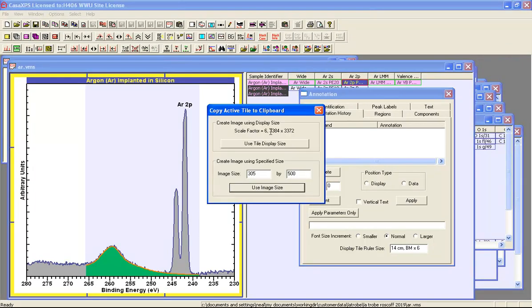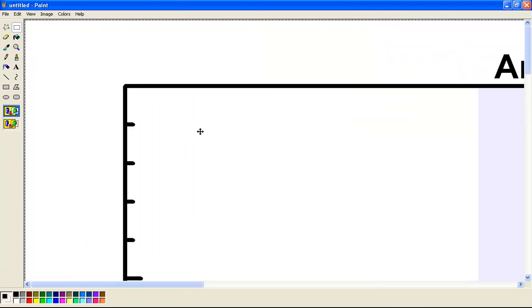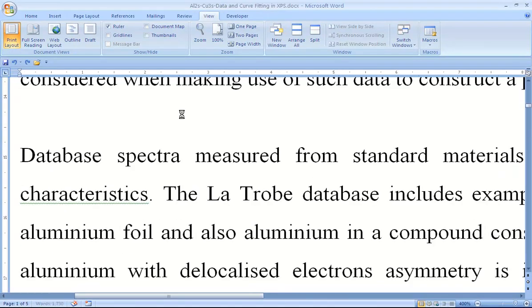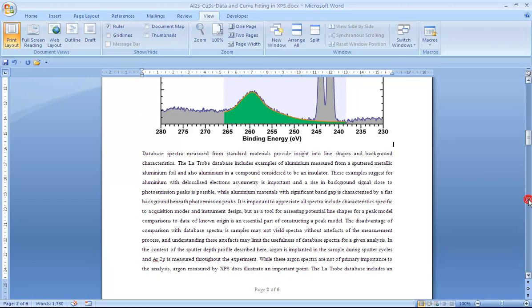and the same action tells us that we've got a scale factor of 6, an increase yet again in the size of the bitmap. So pasting into Paint, you can see the scaling has occurred once again, and let's undo and paste the 600 dots per inch bitmap into Paint. The quality of the text and the lines is now evident. So despite there being little difference as seen here at 100%, we now have confidence because the bitmap and the number of dots per inch has increased to the point that we see a good quality text and lines at a zoom of 400%.